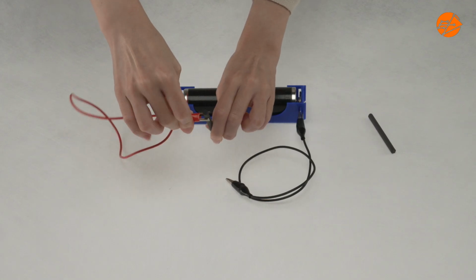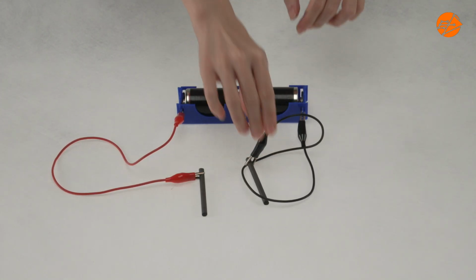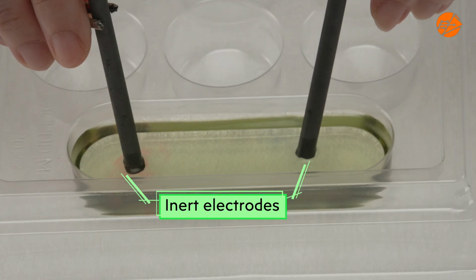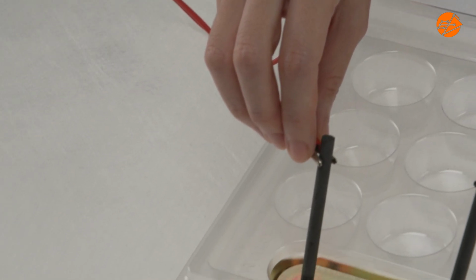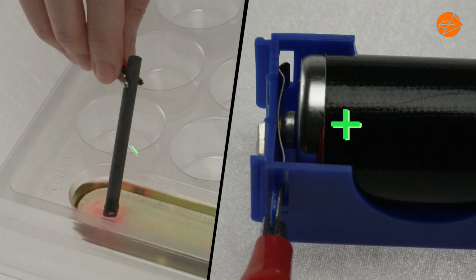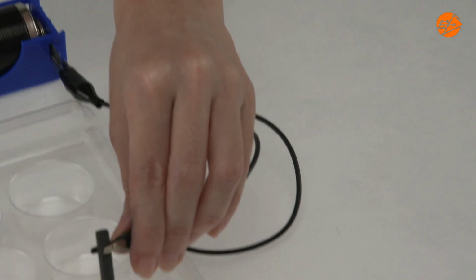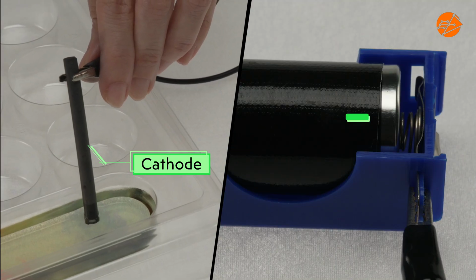Connect 2 batteries to 2 graphite rods using wires with crocodile clips. Insert the 2 graphite rods into the magnesium sulfate solution. The graphite rod connected to the positive terminal of the battery is the anode, and the graphite rod that is connected to the negative terminal of the battery is the cathode.